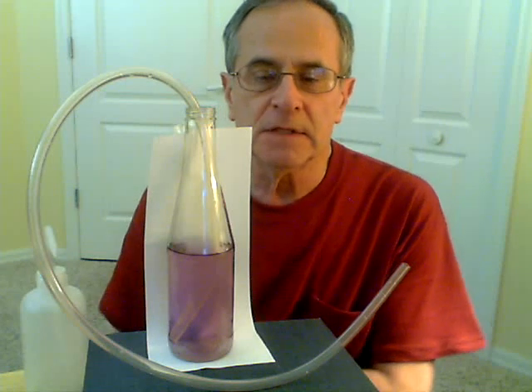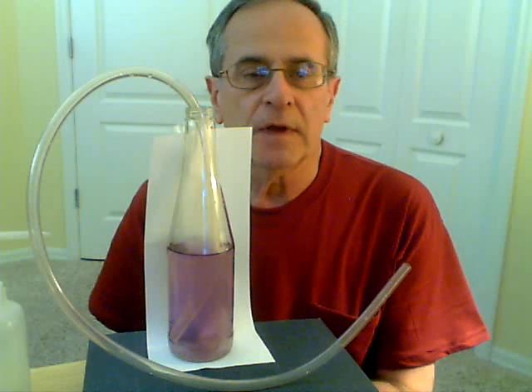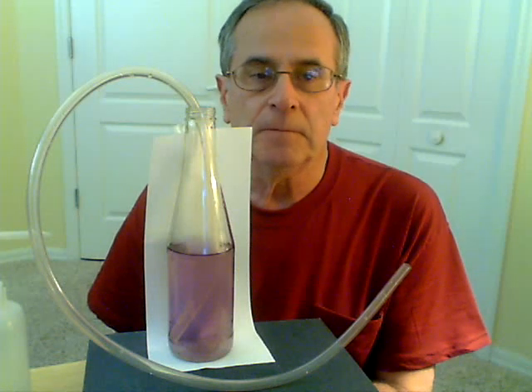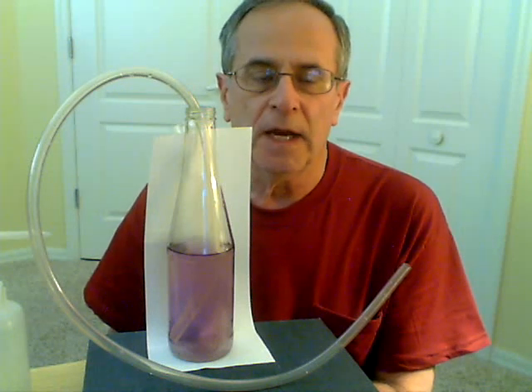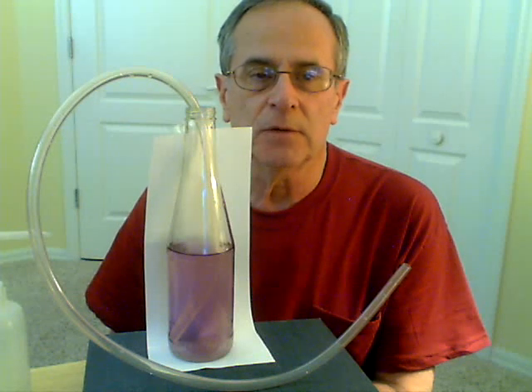I have in this bottle tap water with a little bit of universal indicator. The solution has been made slightly basic with sodium hydroxide, and the purple color is due to the fact that the solution is basic and has a high pH. As the solution becomes more acidic, the color will change, and it should go through a greenish and then a yellowish color.